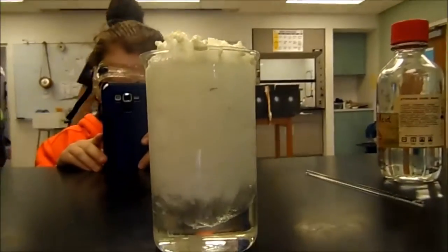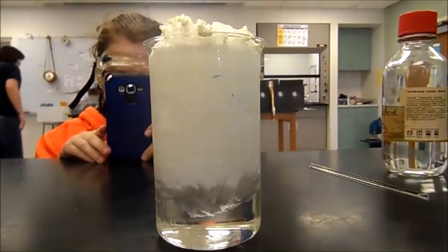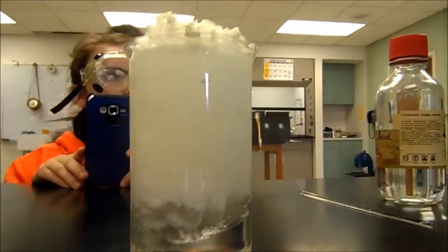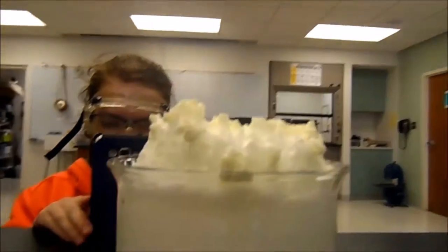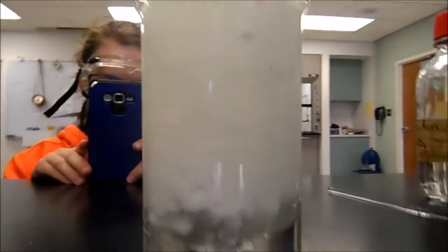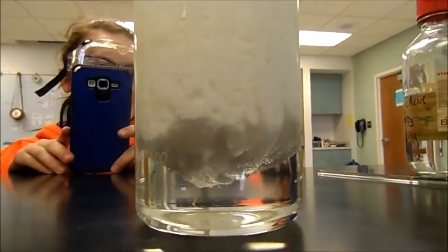Just sink it. That stuff looks yummy, dude. It's like a boiling pot. I will pay you two bucks if you eat that. I'm not going to eat that. It's just like layers of puke. Just stop moving the camera. It looks like reddi-whip.